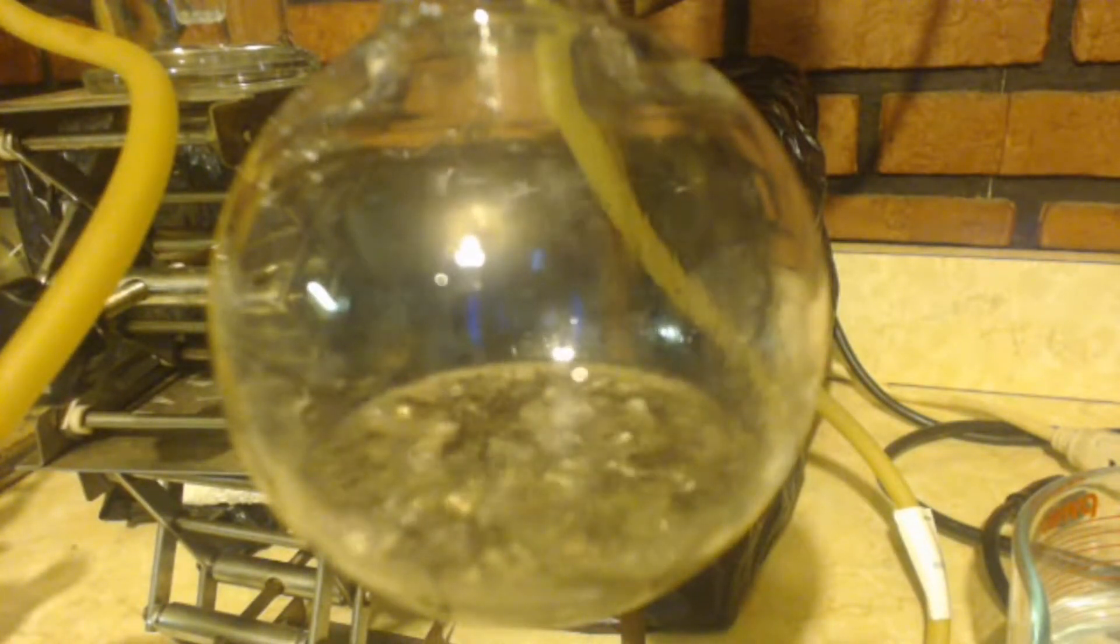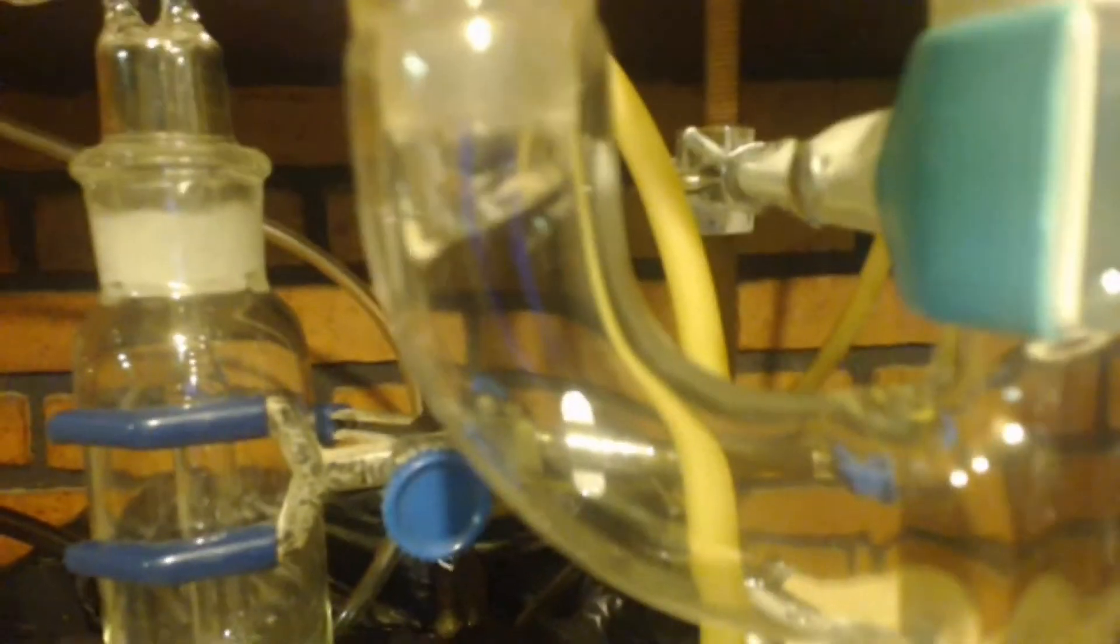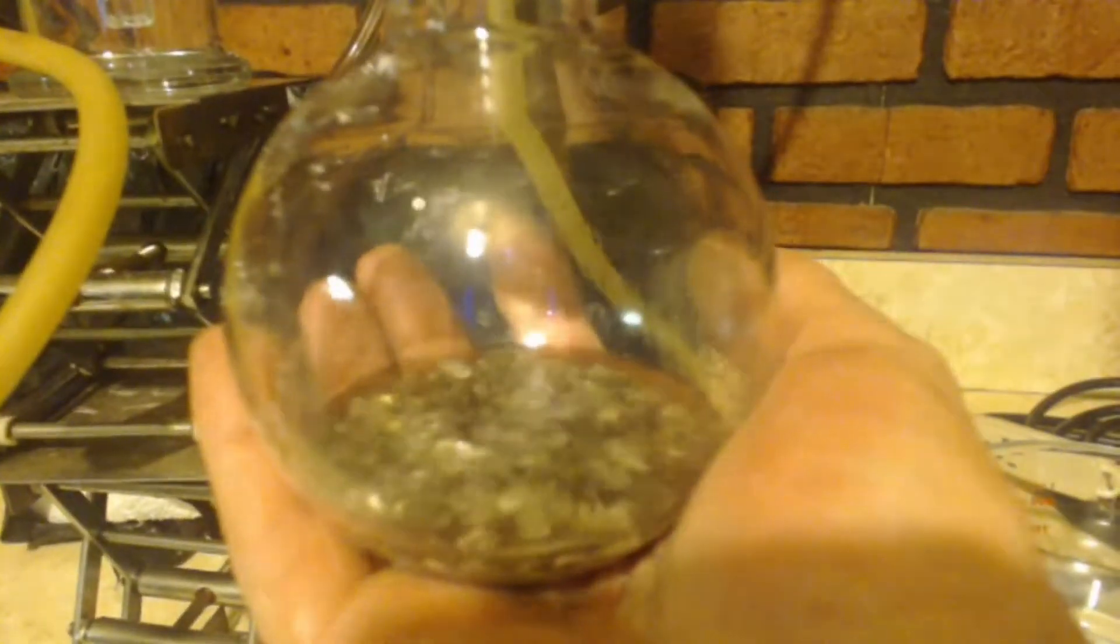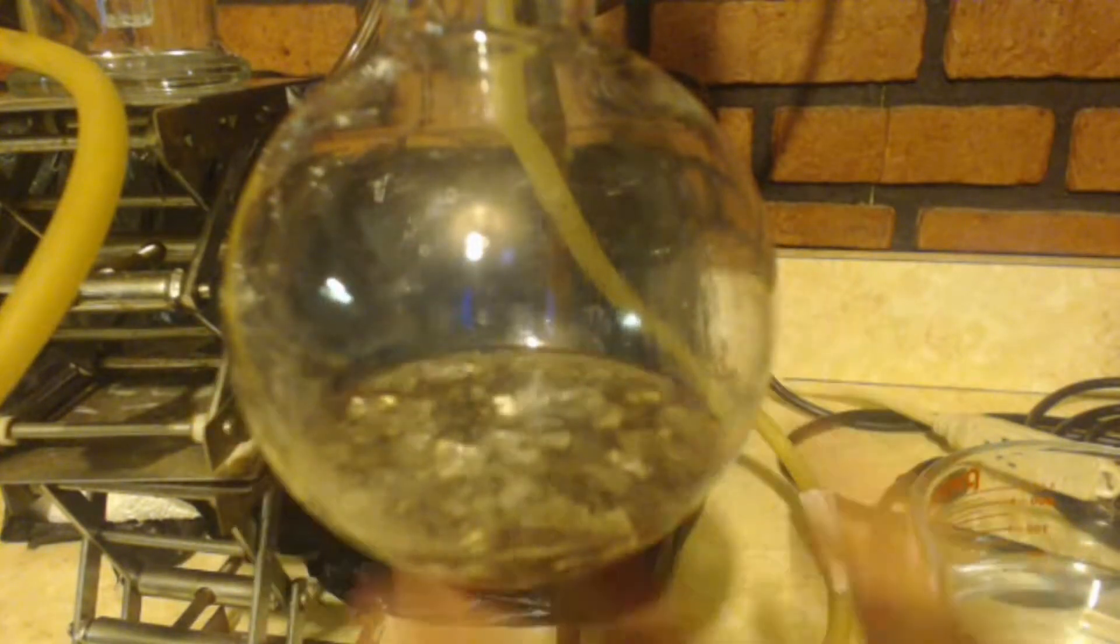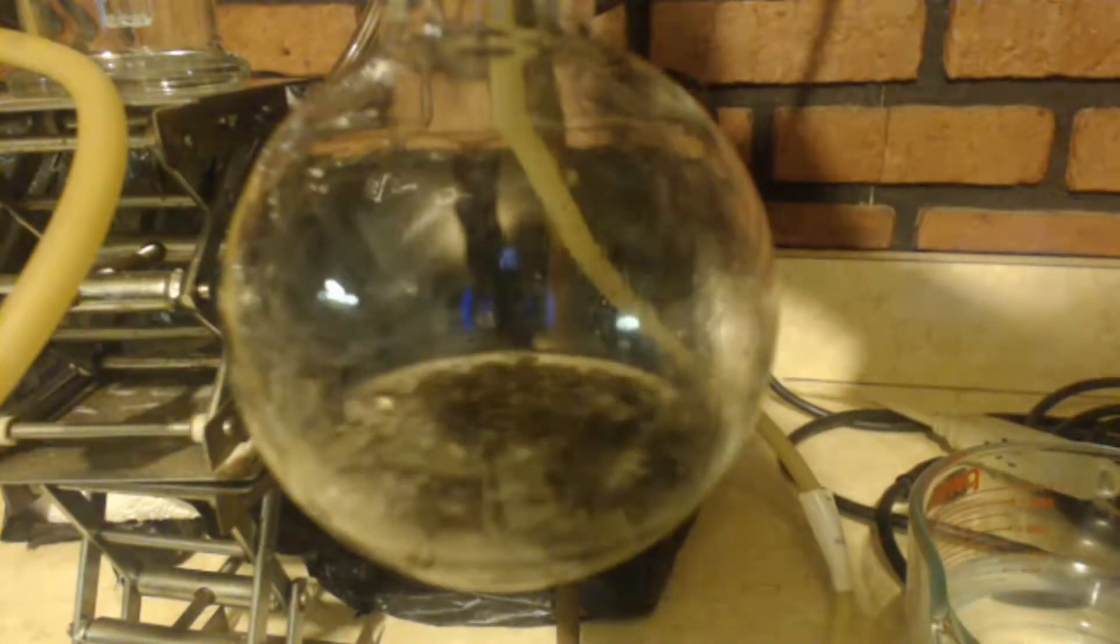I'll show you refluxing out of the condenser. There's my drip rate on the other side, it's coming out fast now. That's too fast.